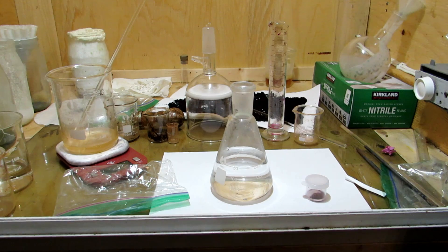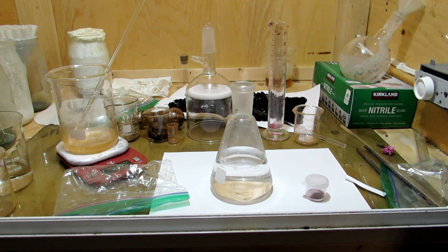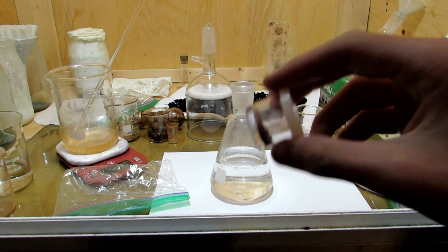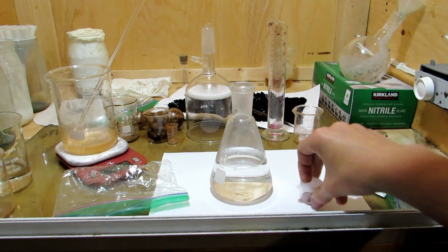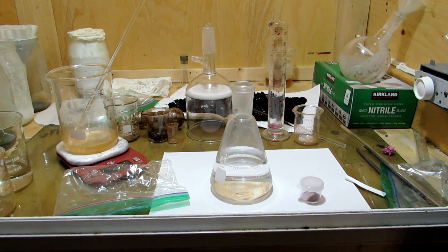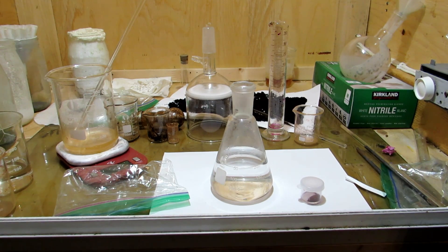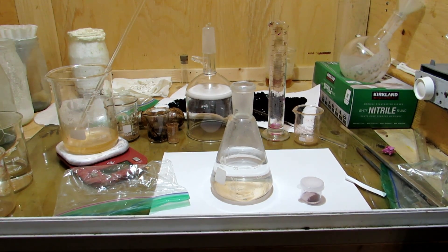If you guys feel up to it, you can go through the whole procedure and try to make your own phenolphthalein — it actually does work. Even though this is only a fifth of a gram, it's going to go a long way. I might dissolve it into an alcohol solution to make addition to solutions easier. Nonetheless, that's basically how to make phenolphthalein — I hope you guys enjoyed, and I'll see you in a future video.